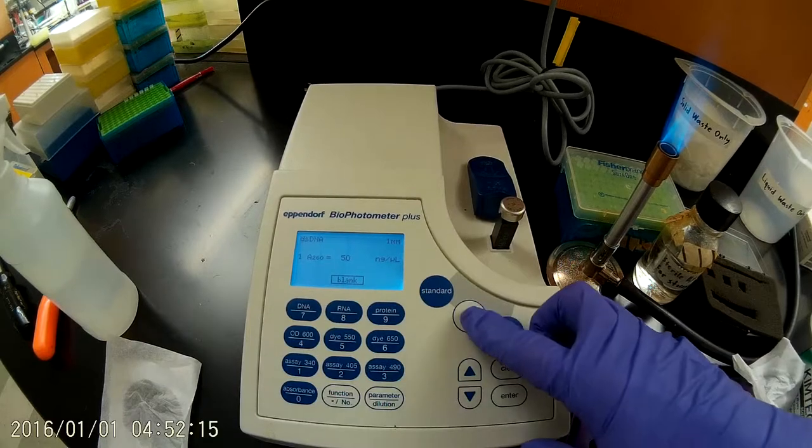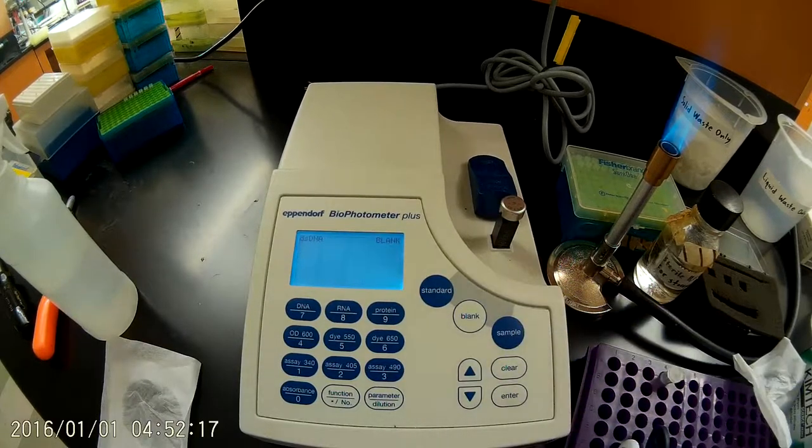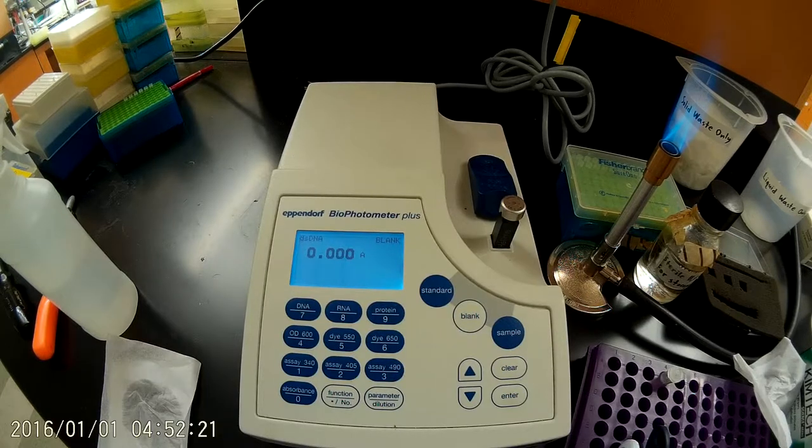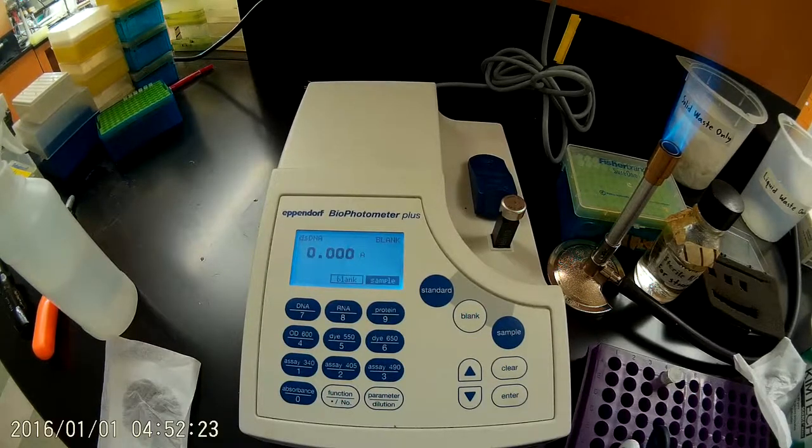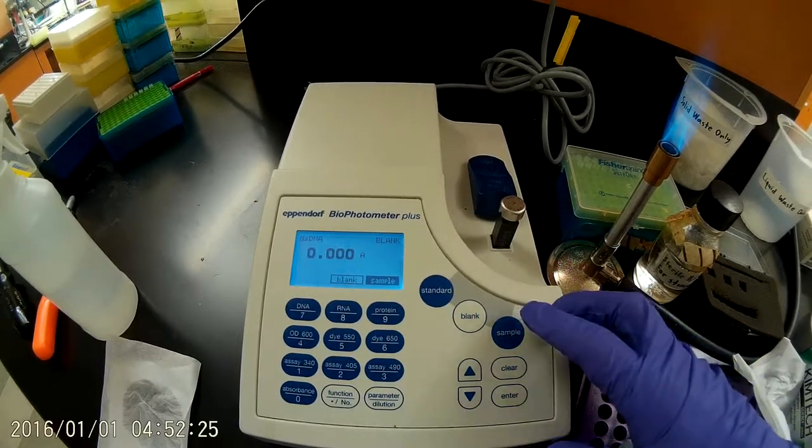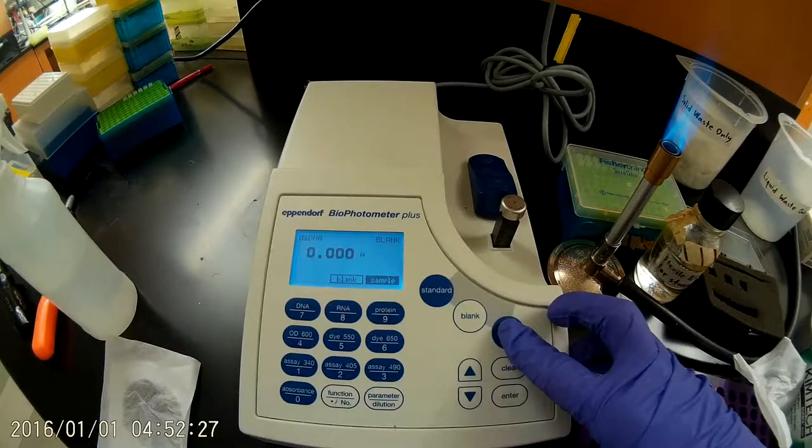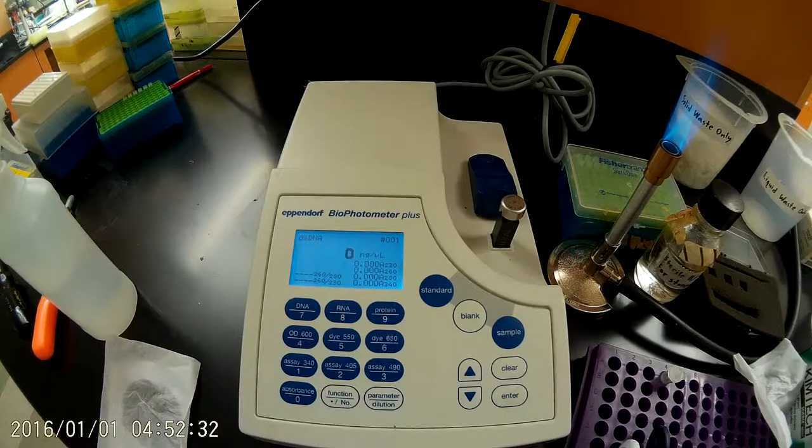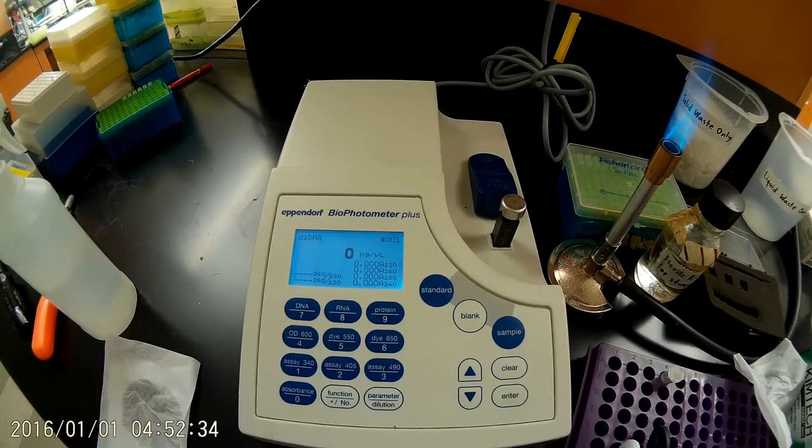Okay, and we're blanking it, so we press Blank. It's worth noting that this biophotometer operates using a xenon flash lamp, so it doesn't really require any time to warm up. Okay, so just to make sure that the blank worked properly, we're going to press Sample now. We should see close to zero for our DNA concentration. And that is indeed what we see.